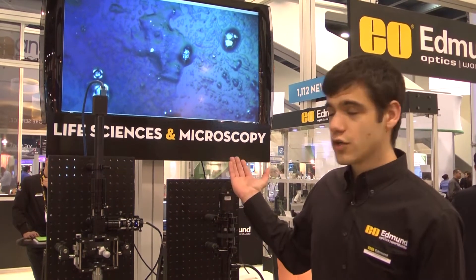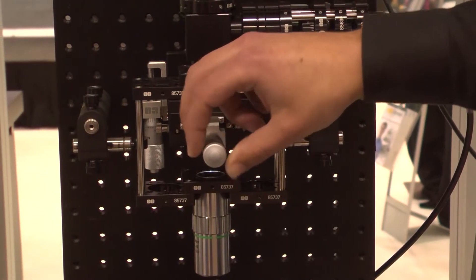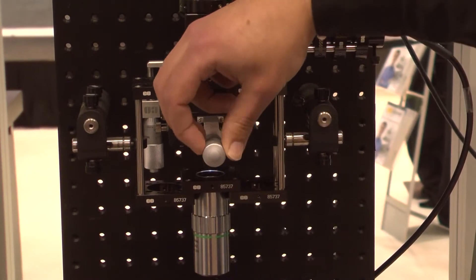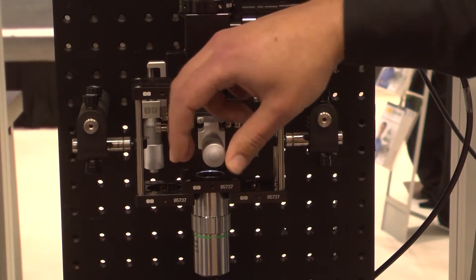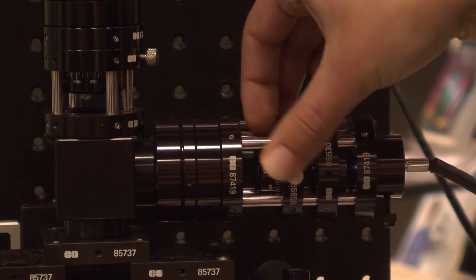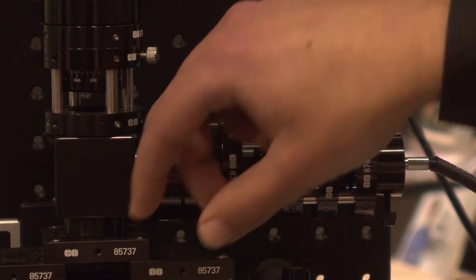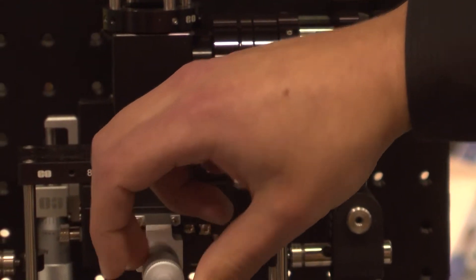In this case you're seeing a fingerprint on top of a resolution target. This entire microscope was built with stock catalog products, and this demonstrates that our catalog provides you with the optics you need to achieve what you want in your projects.